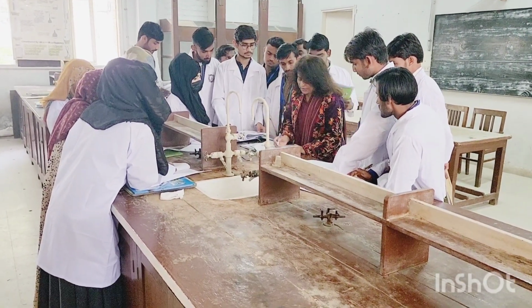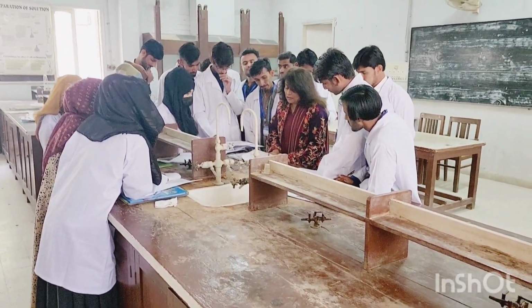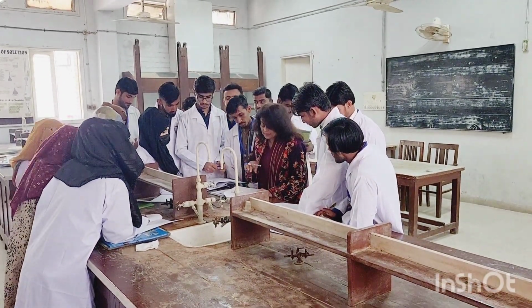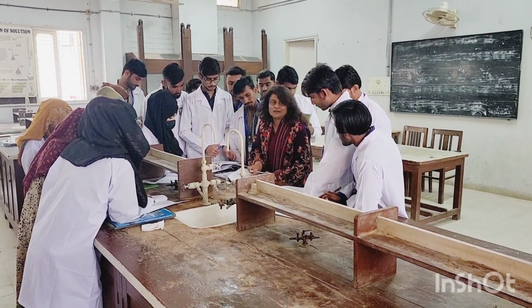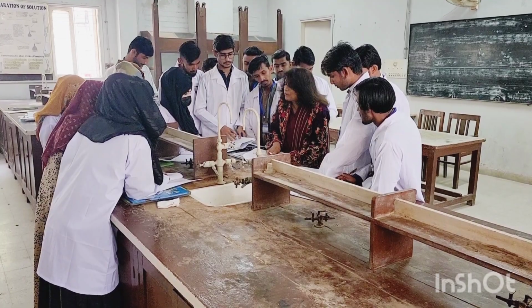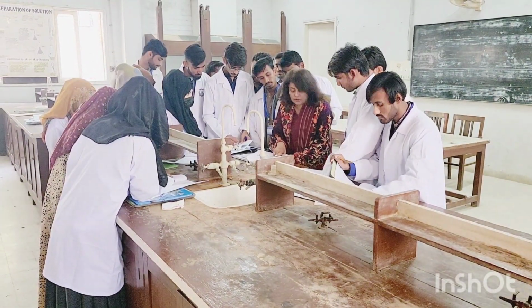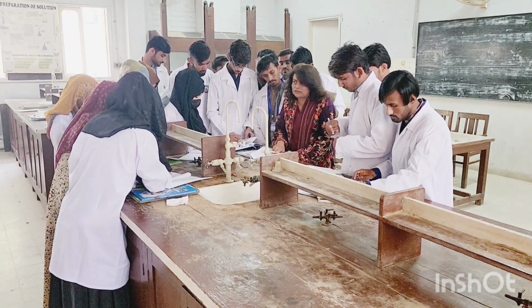But before jumping into this unsaturation test, you have to come across something that is missing here. The solubility test. This is very important. After step number 5, you will do step number 6. You will perform step number 6 as the solubility test.